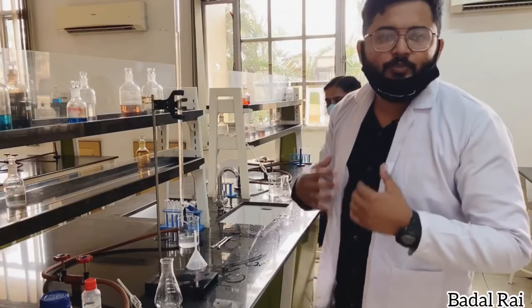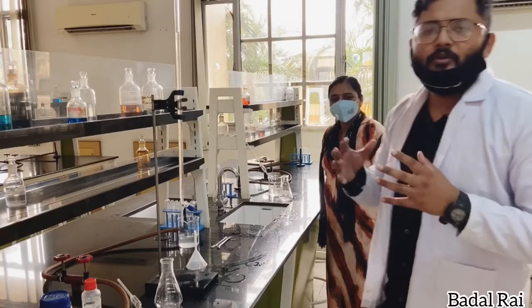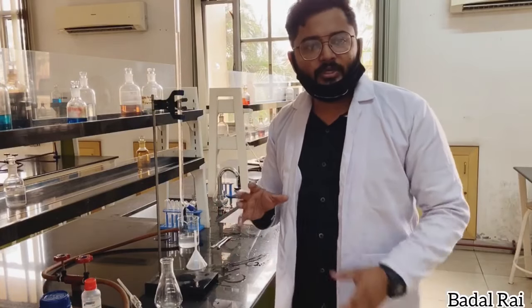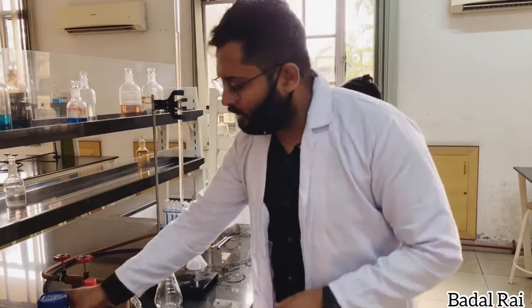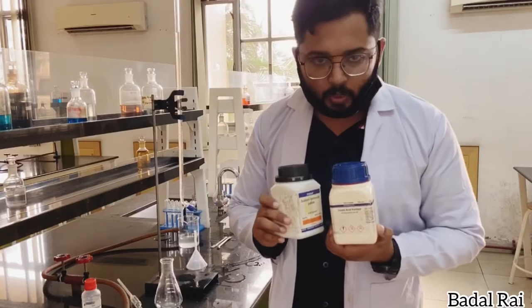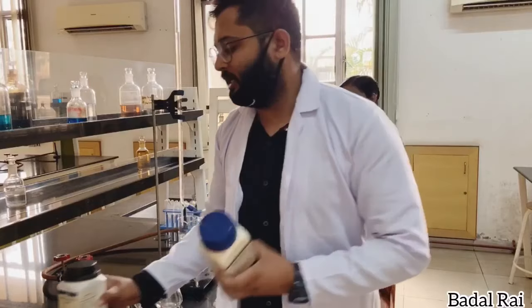Hello students, this is Badal Rai and I am here with my lab attendant teacher Sonia ma'am. Today we are going to perform the titration experiment. Titration involves a reaction between oxalic acid, whose formula is C₂O₄H₂, and sodium hydroxide (NaOH).